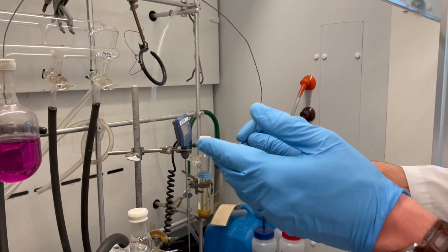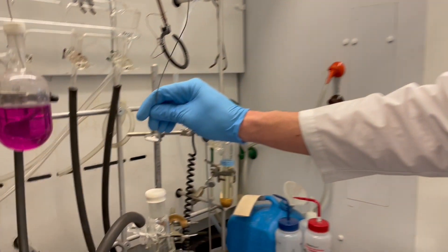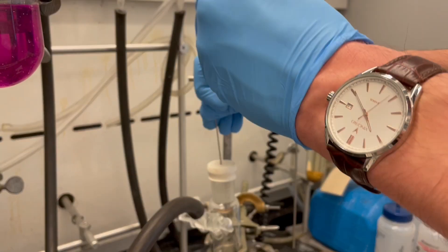Before we do that, we're going to give it a few seconds for the nitrogen to flow through and purge out any air that might be in the needle. Now we can go ahead and insert it into our receiving flask.